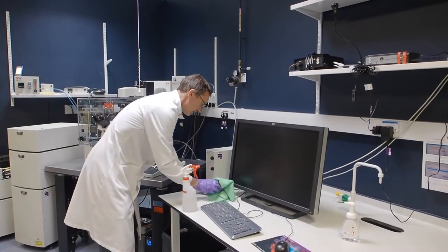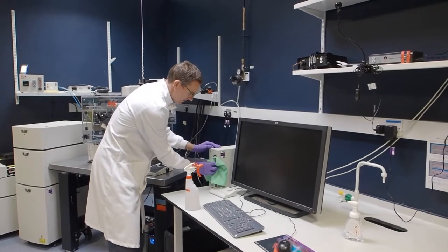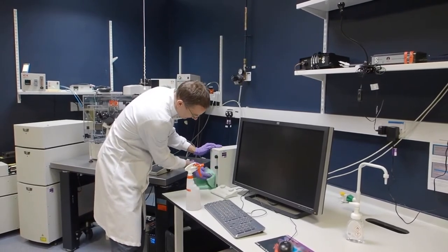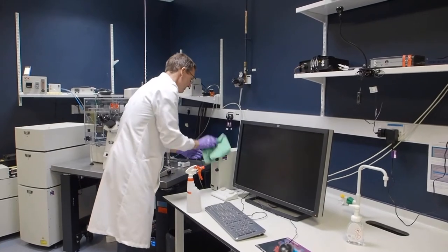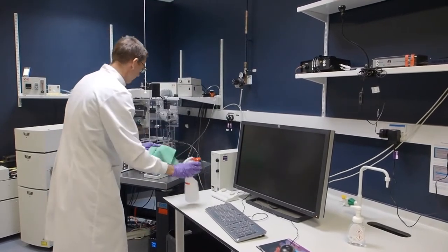Continue to apply more ethanol on the provided cloth if necessary and clean the microscope controls, including Colibri LED controls, peripherals of the system such as the main power boxes, joystick, and the microscope stand.